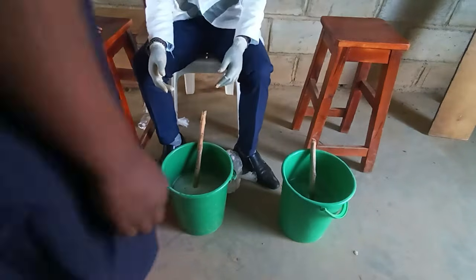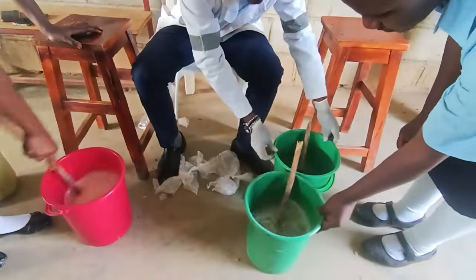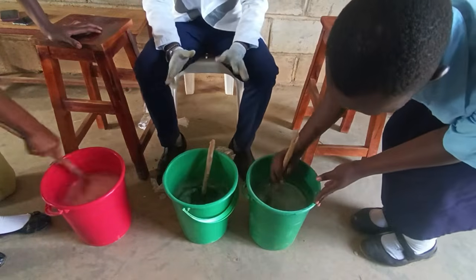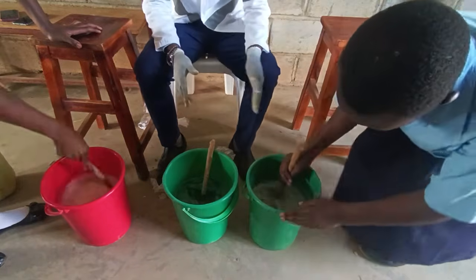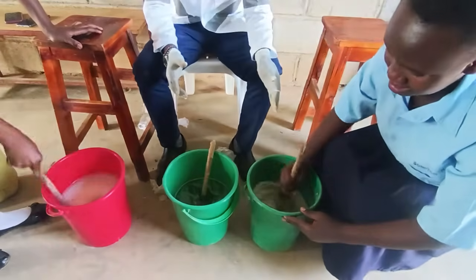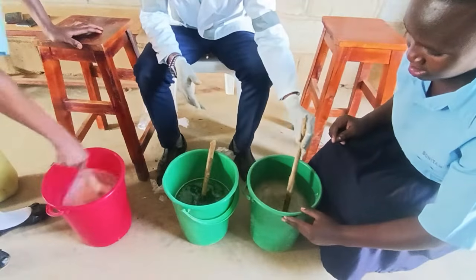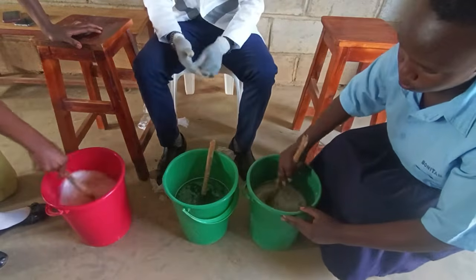Okay, you can go the other side, and then you dissolve also that. Let's leave it there. Stir from there. So at this point, they are just dissolving these two chemicals. So what is happening there? Is it very sticky, very strong? It's very strong. Okay, let me see. Initially it was somehow sticky, but you can see now it is dissolving slowly. Okay, you can keep on dissolving.